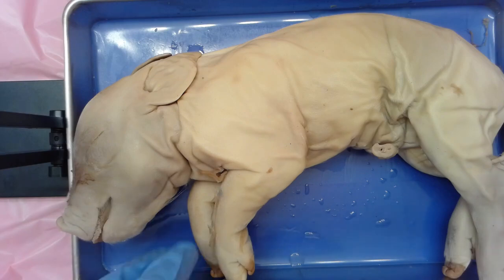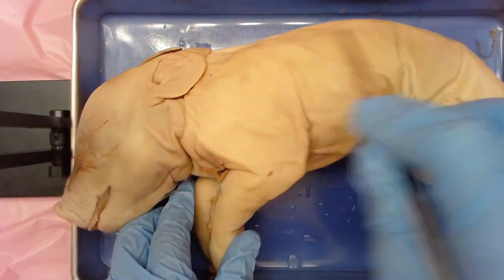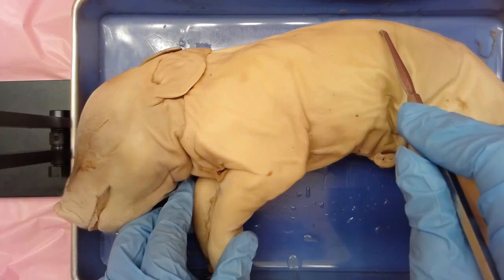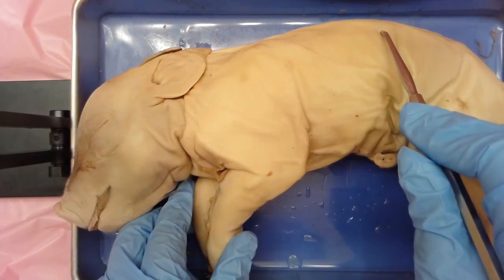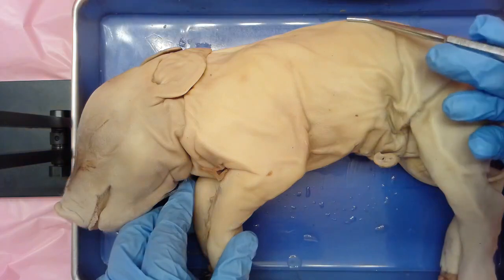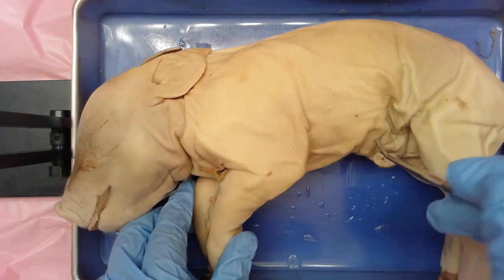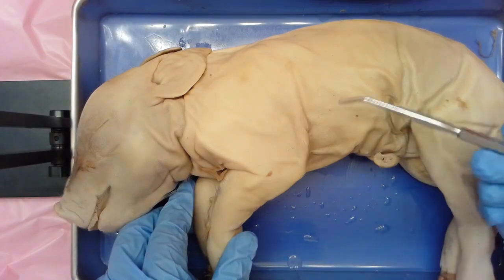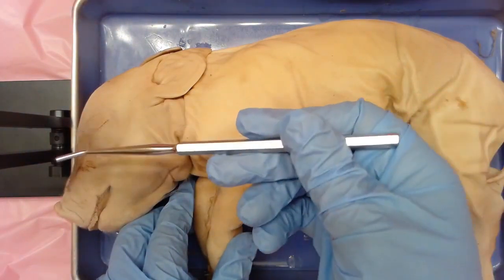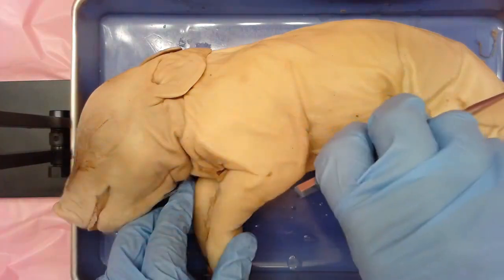The first term we want to describe is dorsal. Dorsal is going towards the back of the animal — you might have heard of the term dorsal fin, like on the back of a dolphin or the top part of a shark. Ventral is going to be the opposite direction, kind of on the belly surface. Anterior is moving towards the head region, and posterior is going to be moving towards the rear.